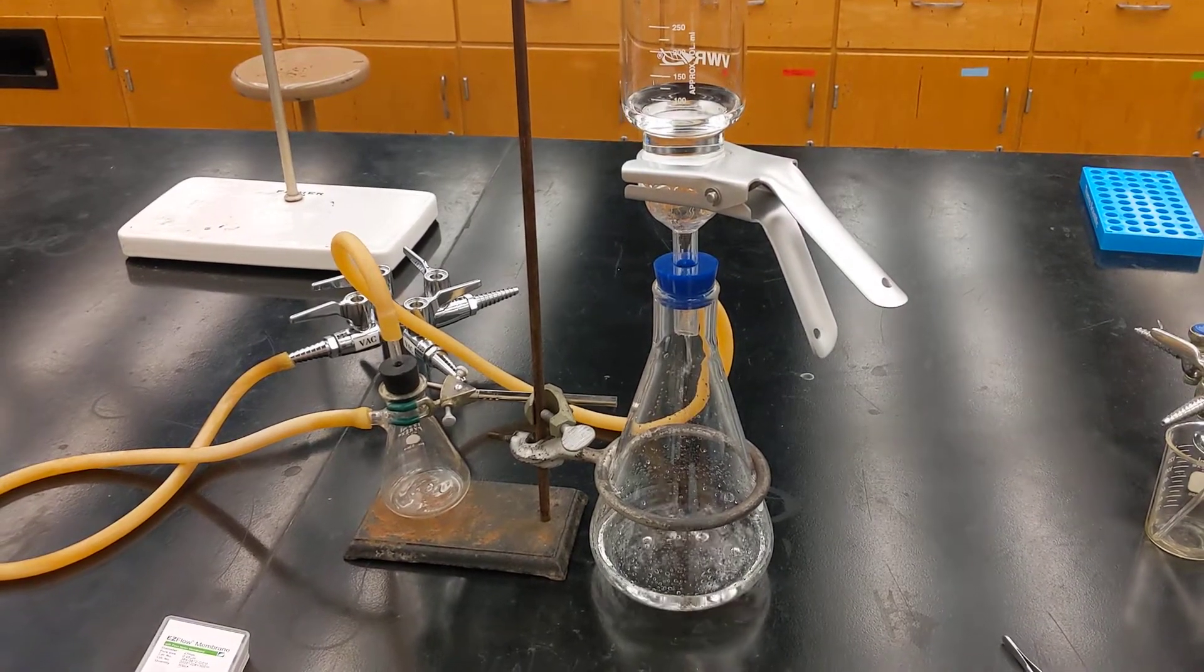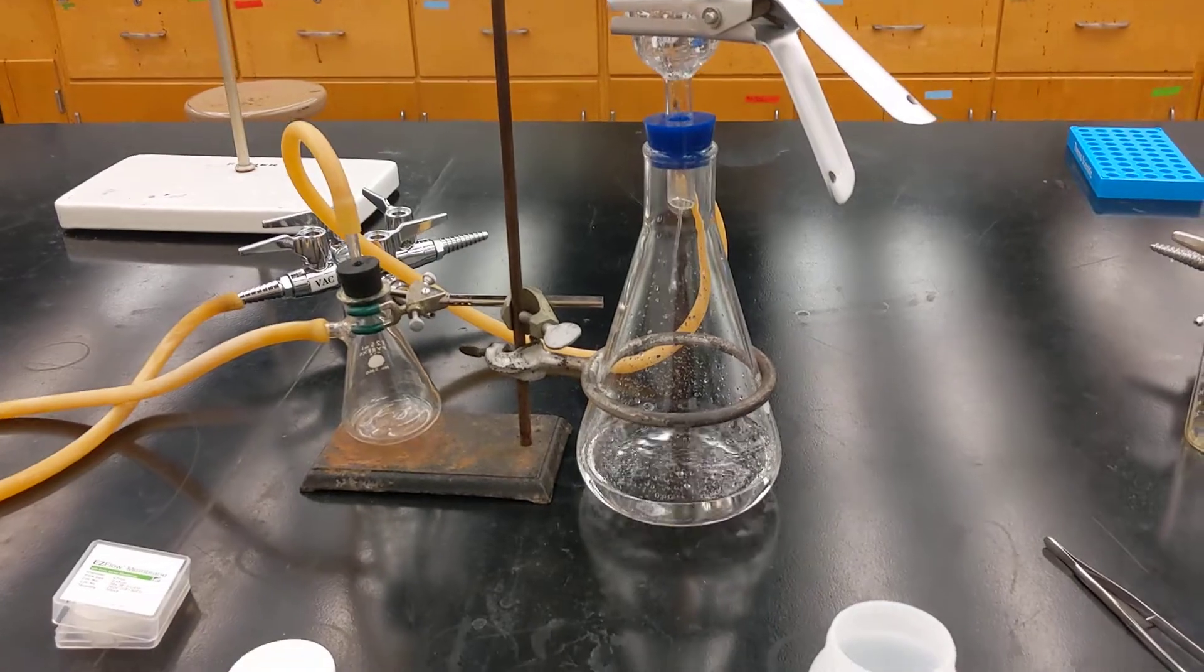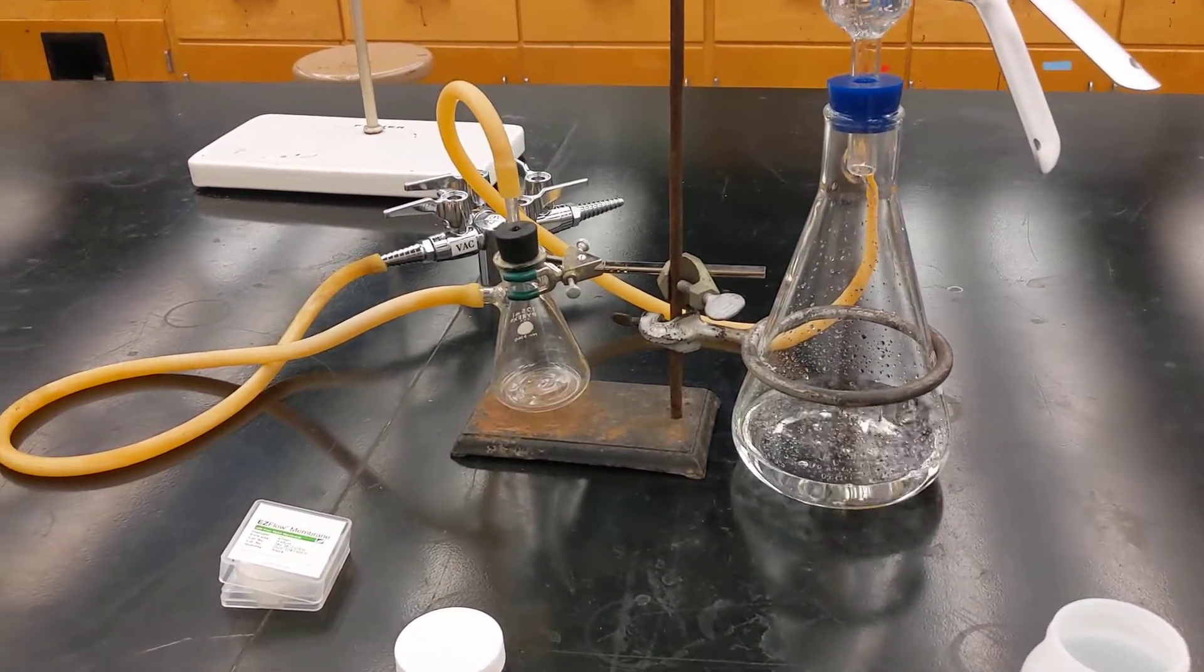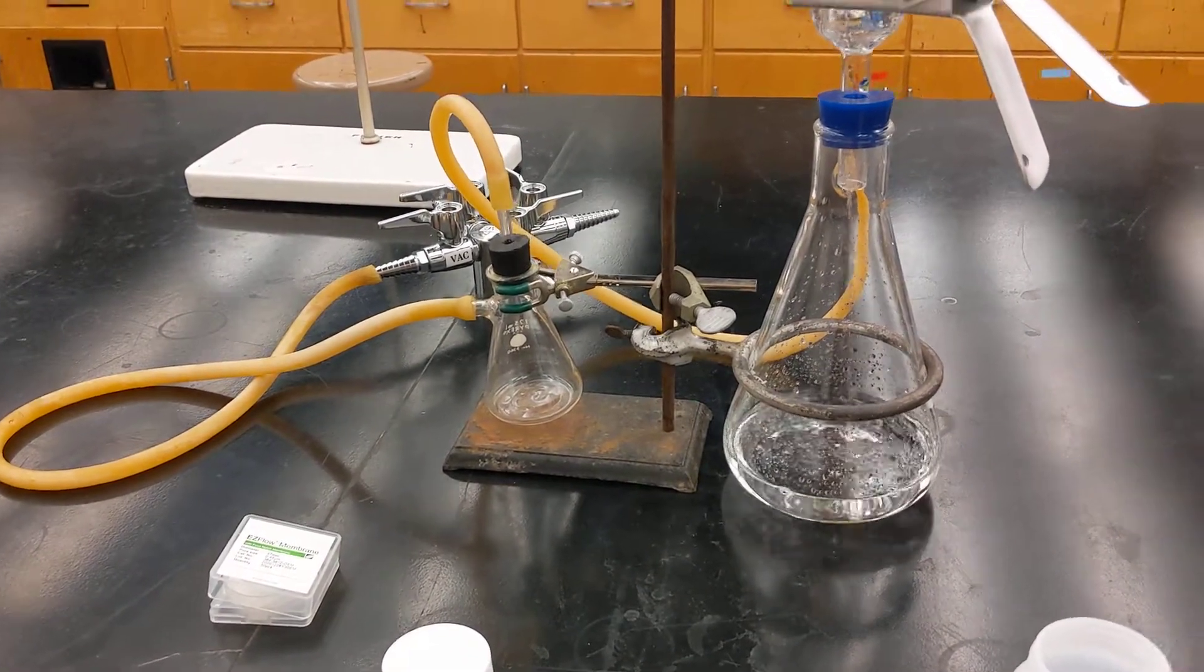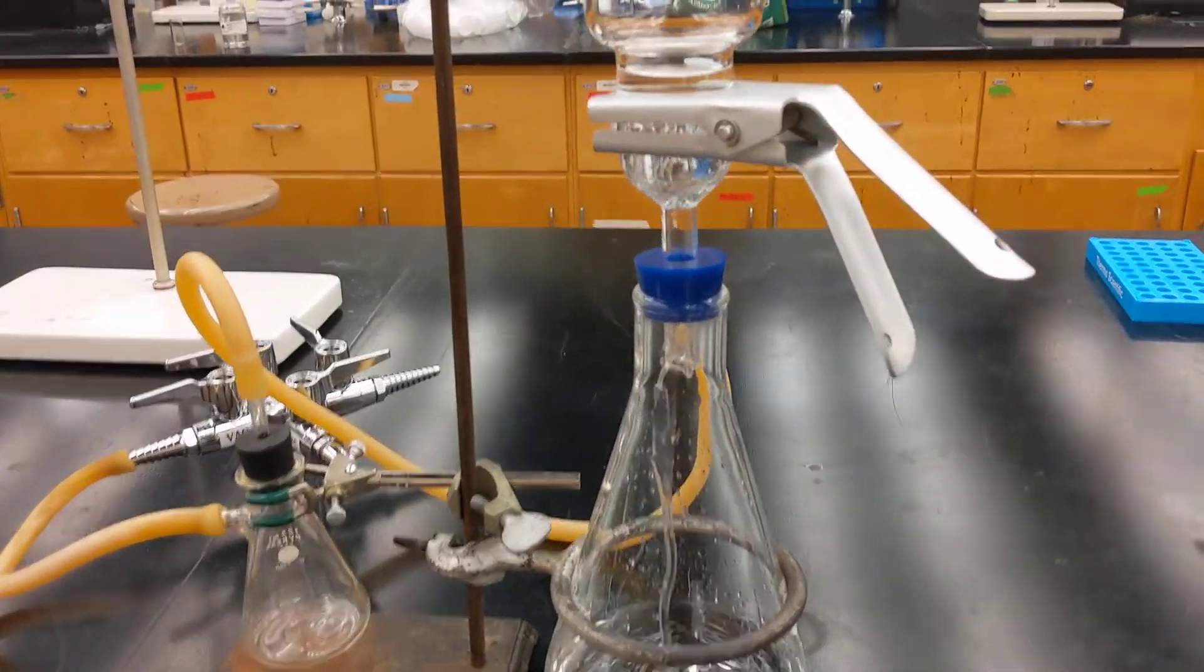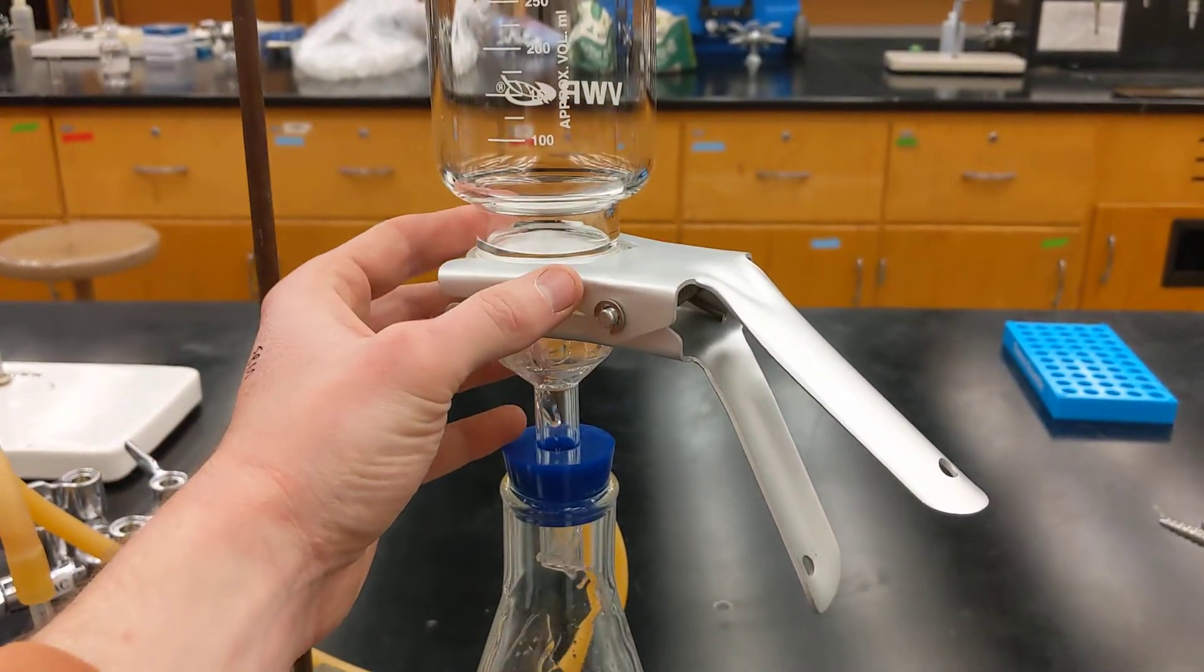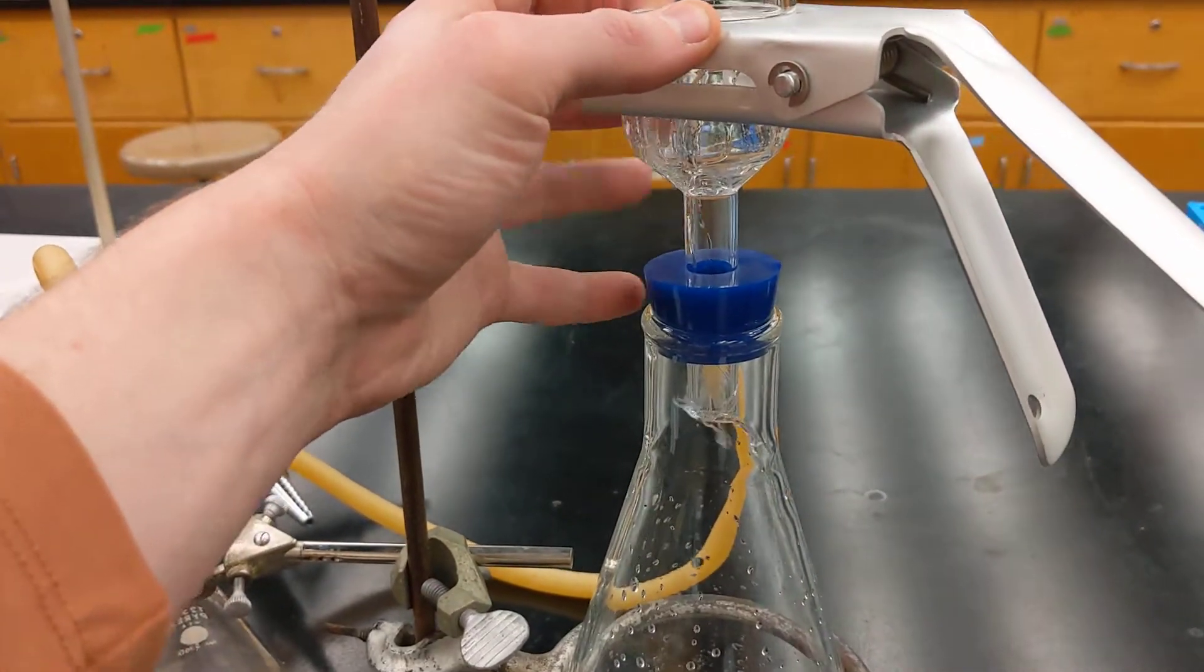Once the filtration is done, which it almost is, you will want to turn off the vacuum and then disassemble your filtration apparatus, being very careful not to break these objects. Remember, this is under vacuum.